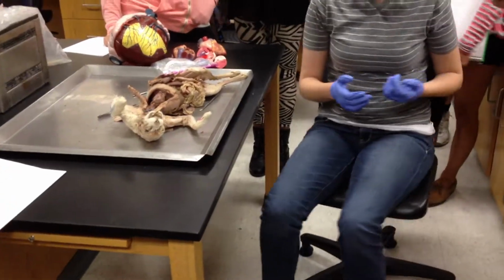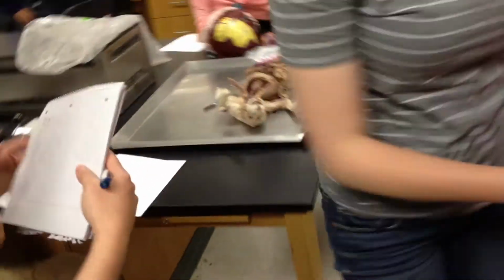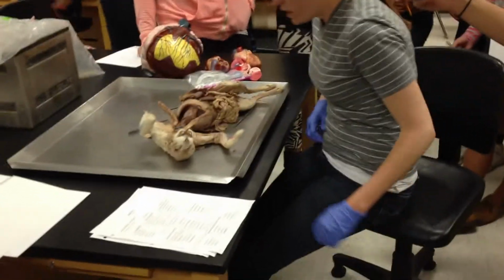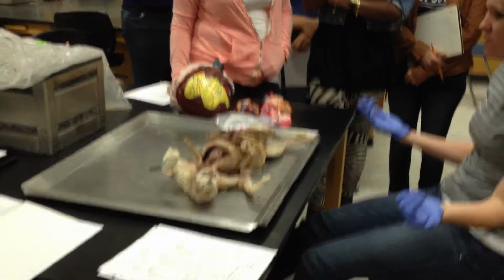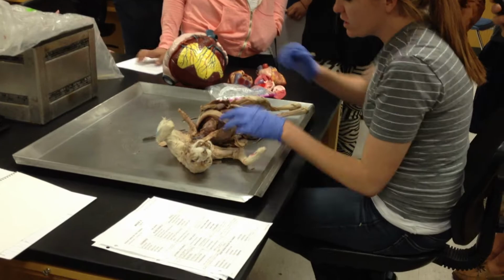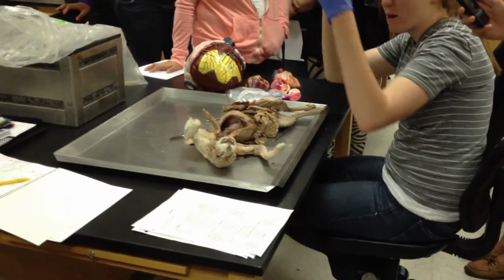So the pulmonary veins, you can only view them from the dorsal side of the heart. Okay. When you guys dissect, you're going to have to take the lungs out. And I think we have an extra group now, so people are going to have to adopt one or two people. Sad, there's no more. Okay. You're going to dissect out the lungs, so you just chop them out. Just lift and chop. Okay.